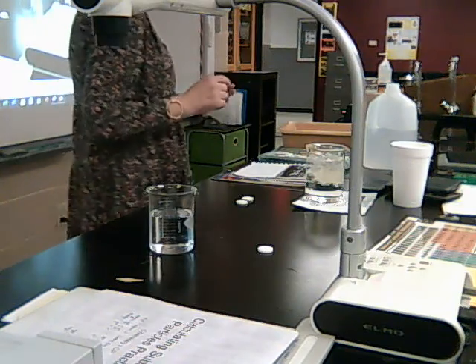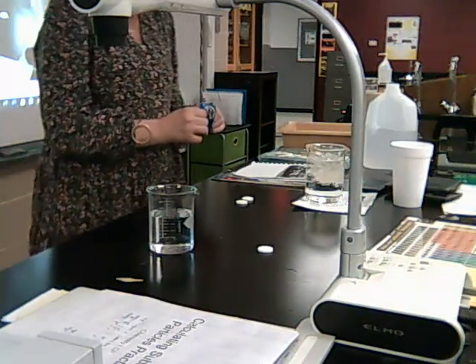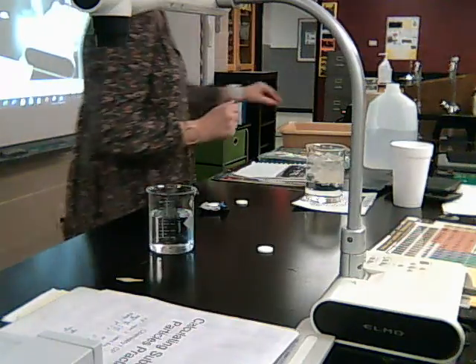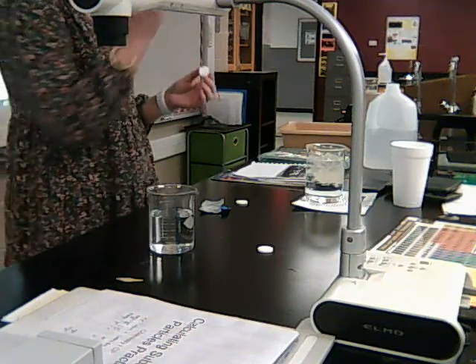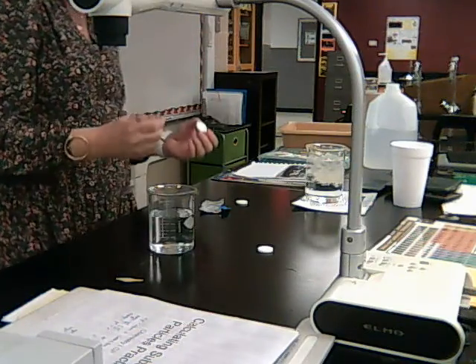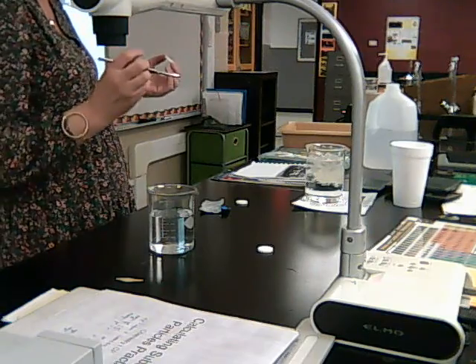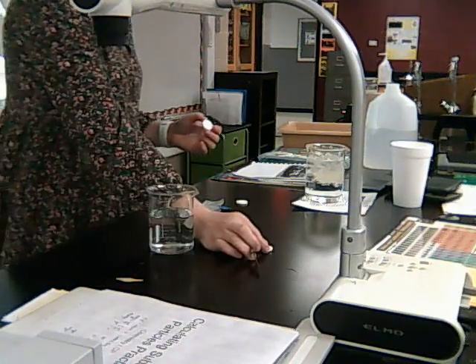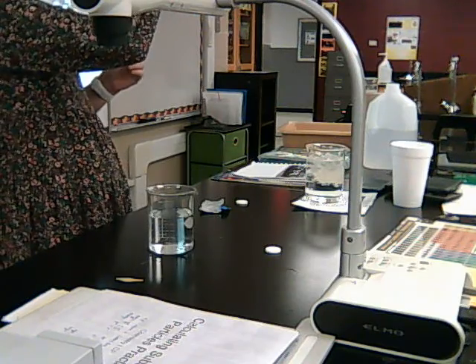My second tablet, I thought I would cut in half. It's kind of hard to do that. So I've got this little scalpel that I'm going to use, and what you do, I don't know if you guys have ever heard of this, it's called scoring. I'm going to scratch it, make a little crack in it, and then I can just break it and it'll break in half. So again, I'm still going to use a whole tablet because I don't want to change the amount of Alka-Seltzer. I'm going to use one entire tablet for every test. It's just that one test is going to have the tablet whole. The other test is going to have the tablet in halves.